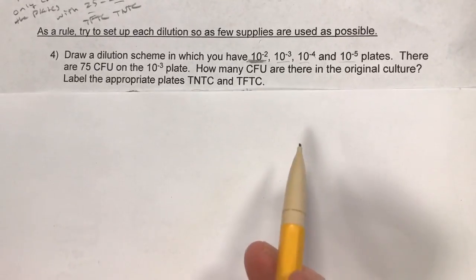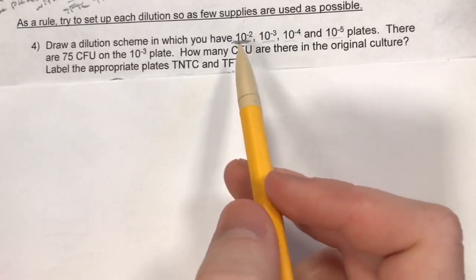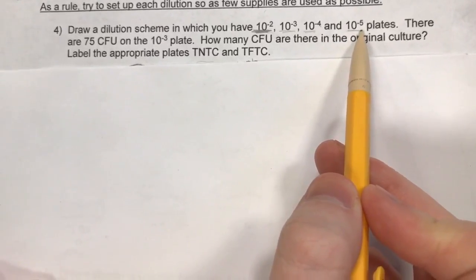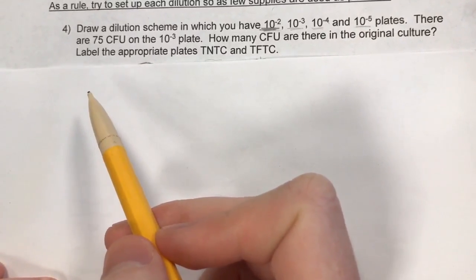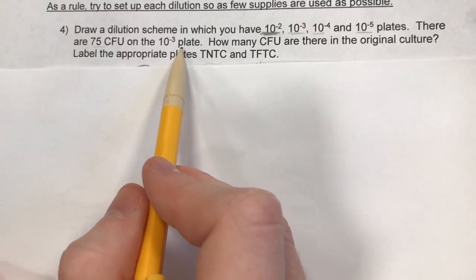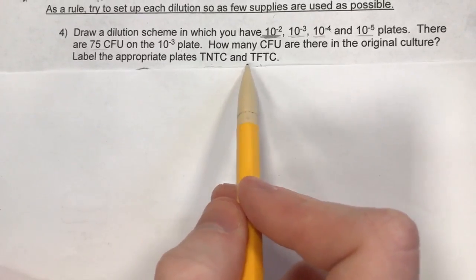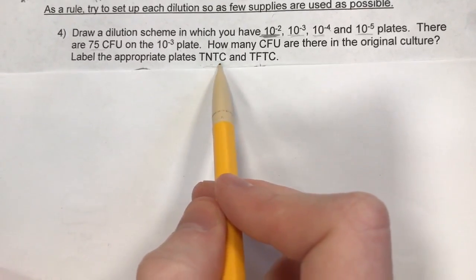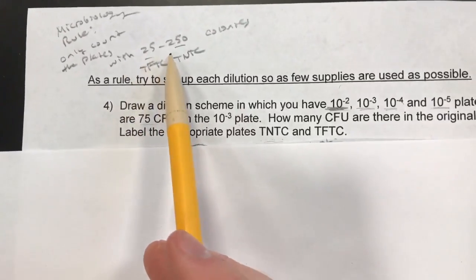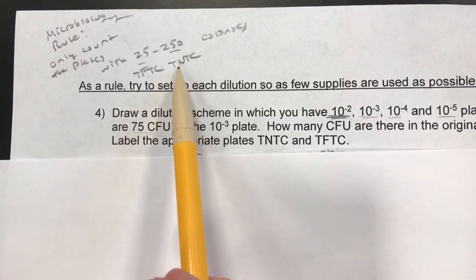Here's an example from our lab book on dilution schemes. It's basically like what we were doing before but we're going to add a few more elements. In this case we're going to need 10 to the negative 2, 10 to the negative 3, 10 to the negative 4, and 10 to the negative 5 plates, derived from the skills learned previously. We're also given that we have 75 CFUs, or colony forming units, on the 10 to the negative 3 plate. We're going to have to label the plates TNTC and TFTC — meaning too numerous to count and too few to count. An important microbiology rule is that you only want to count the plates with 25 to 250 colonies.